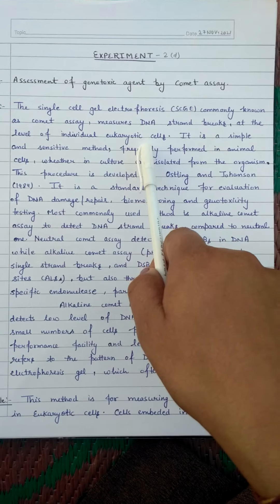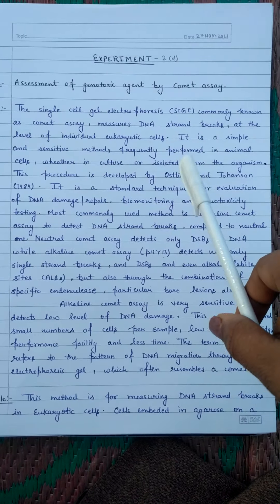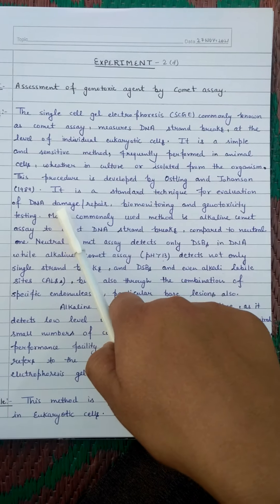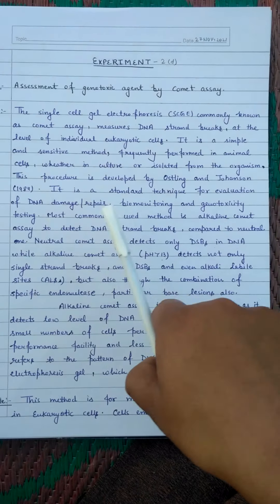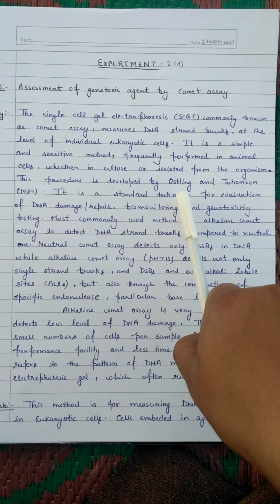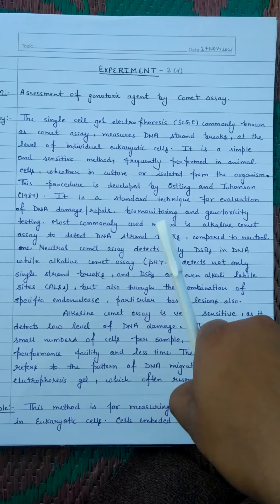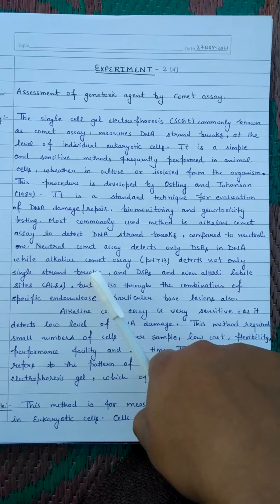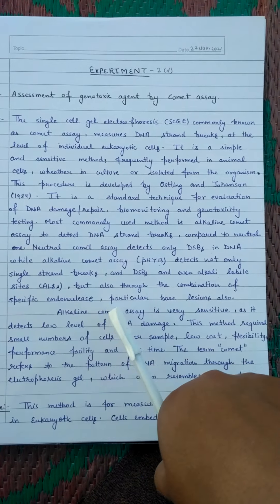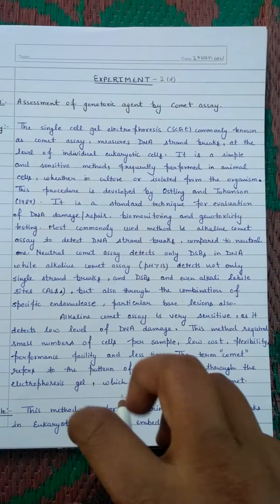This is a very simple and sensitive method. With the help of this method we can evaluate DNA damage or repair, and its biomonitoring and genotoxicity testing. This method was developed by Ostling and Johansson. It helps in the detection of single strand breaks, double strand breaks, or even alkali-labile sites present in the DNA. This method is of two types.